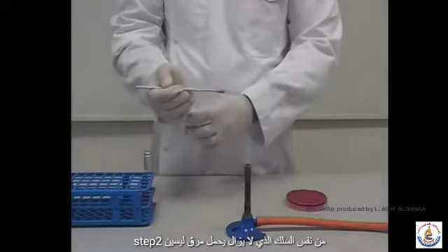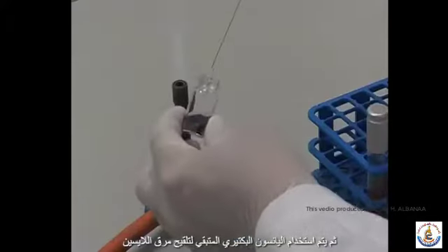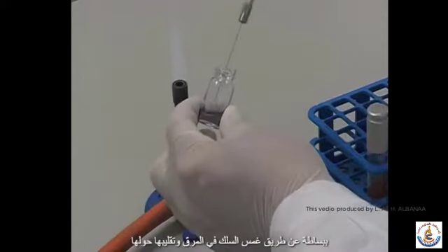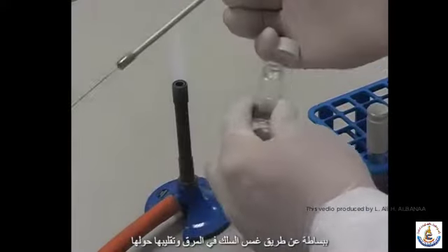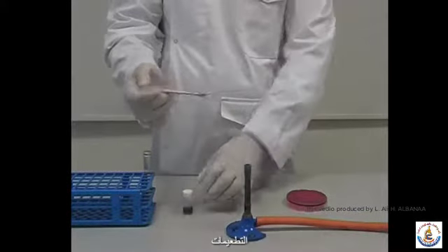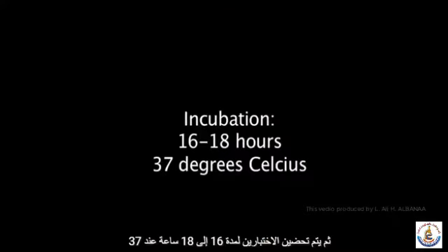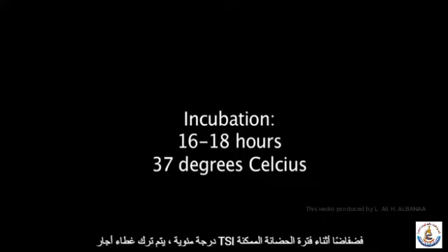Step 2. Inoculation of the lysine broth. The same wire, which still carries residual bacteria on it, is then used to inoculate the lysine broth. This is done simply by dipping the wire into the broth and stirring it around. Note that the wire is not held in the Bunsen flame between the two inoculations. The two tests are then incubated for 16 to 18 hours at 37 degrees Celsius. The lid of the TSI agar is left loose during incubation.